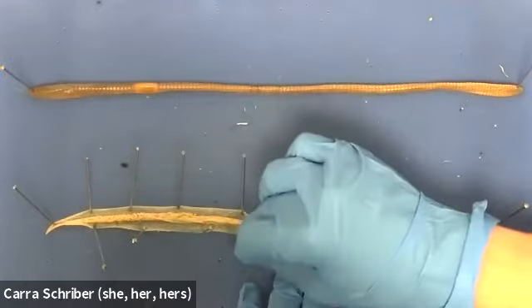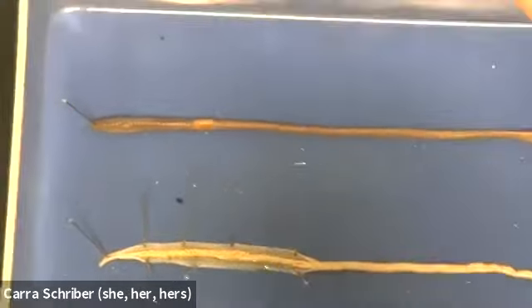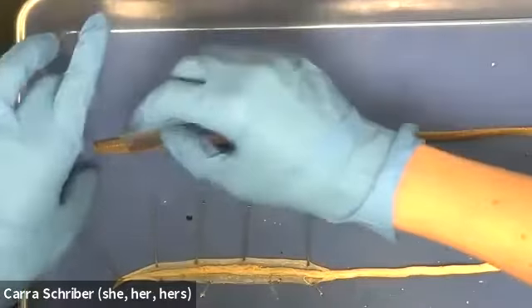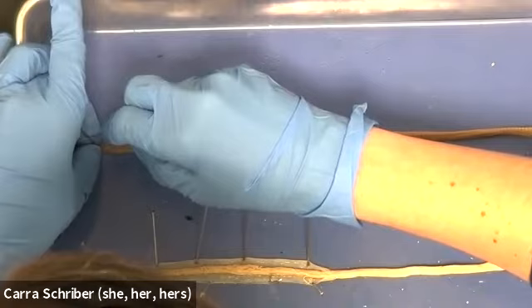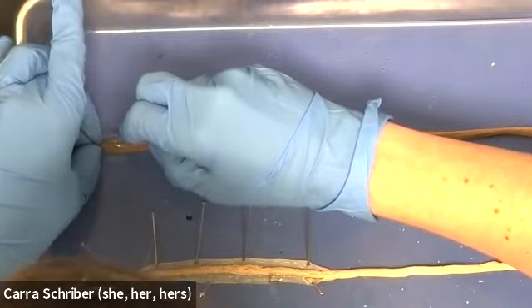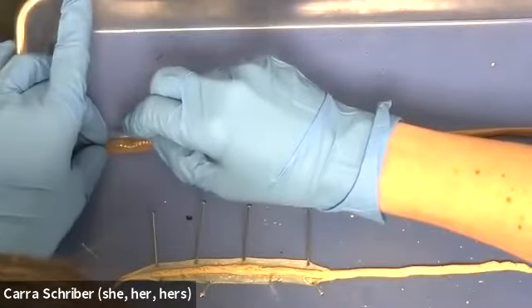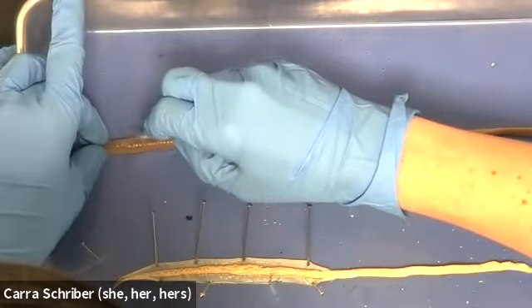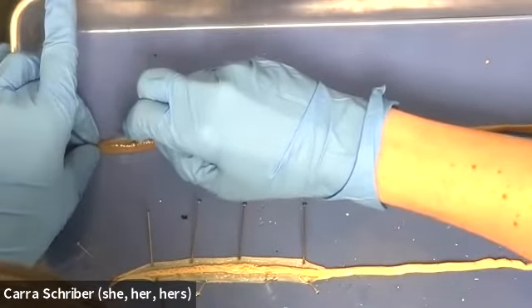Okay, and I think that you get a pretty good feel at this point about how easy that process was. Now let's take a look at our earthworm and try to open the earthworm up. So I'm going to make an incision starting towards the head region. And where this felt really easy, this feels kind of like I'm cutting through a rubber tire. It does feel a lot like rubber.